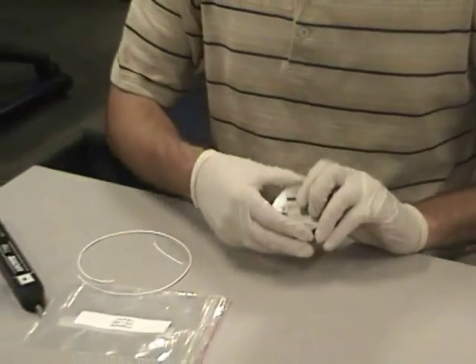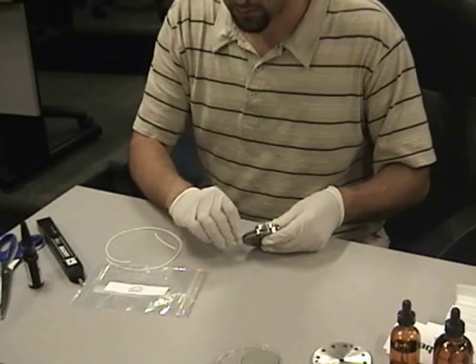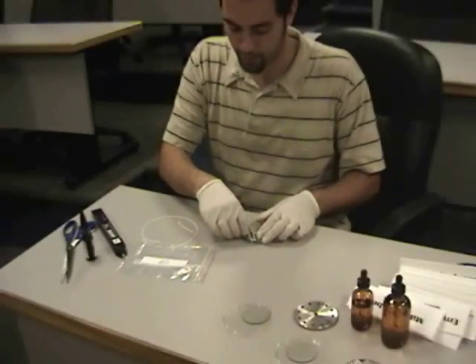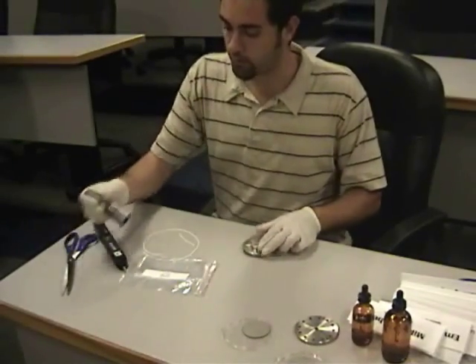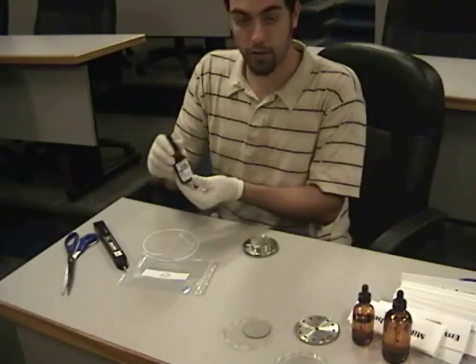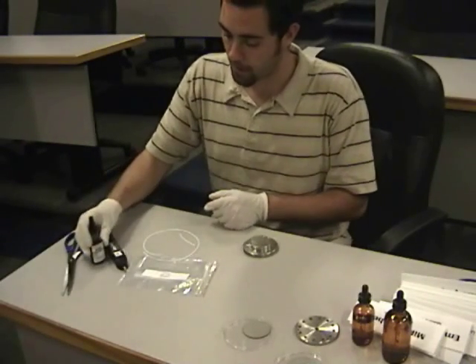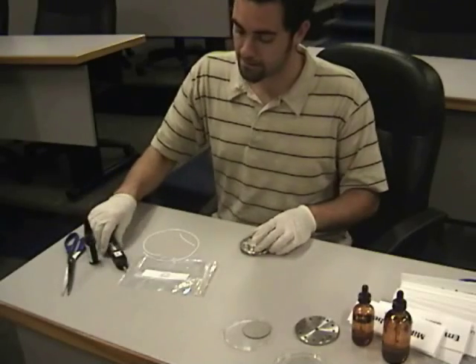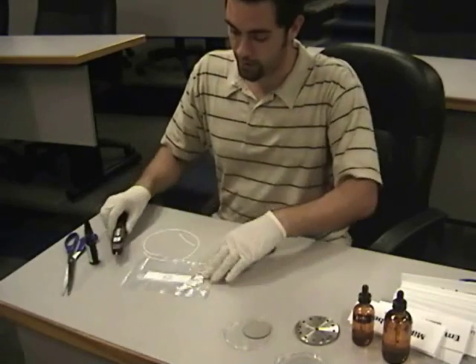Once the sample is in place, you will glue it. We use a light cure adhesive. Place it on there and use your light stick.